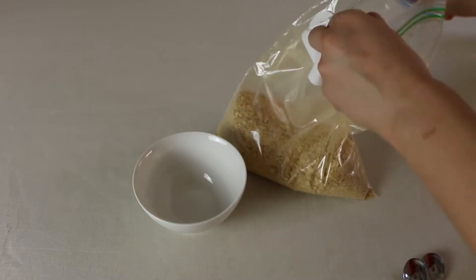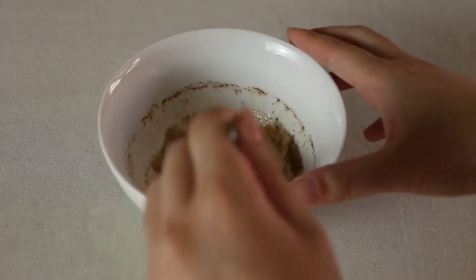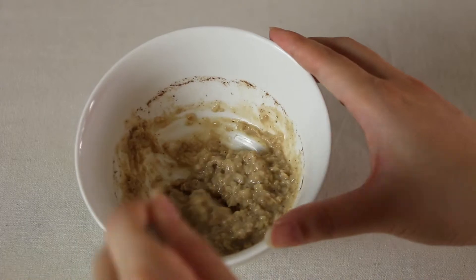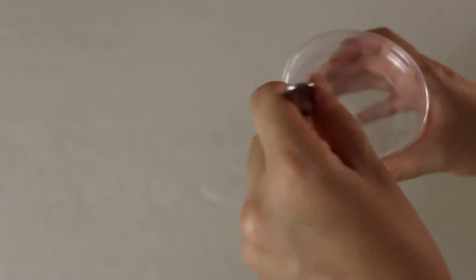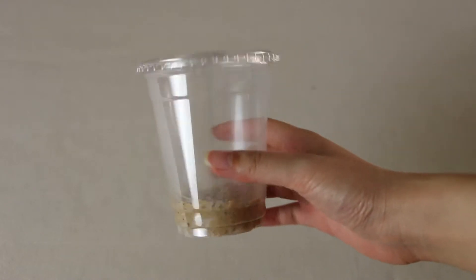Let's continue with actually starting the culture. From this mix, I take about one tablespoon or three teaspoons and put it into a bowl with just enough water to cover the mix. In the microwave it goes — in my case for 30 seconds, as it's a high power microwave. Once done, give it a good mix and you want it to have the consistency of mashed potatoes. If it seems a bit dry or sticks together too much, add a bit more water and mix it until it feels just right. A little bit of water will go a long way and you don't want it to get too runny. Bring the media into the bottom of the cup and smooth it evenly so that the entire bottom of the cup is covered in a layer of media. Let the media cool to near room temperature and don't forget to leave the lid on while you do this, otherwise pesky wild flies might come in and contaminate your mixture while you're not looking.